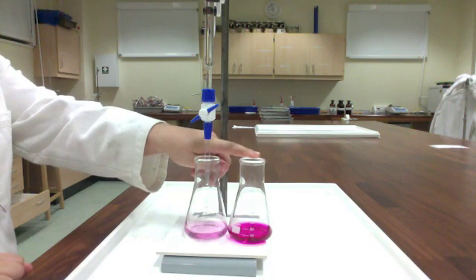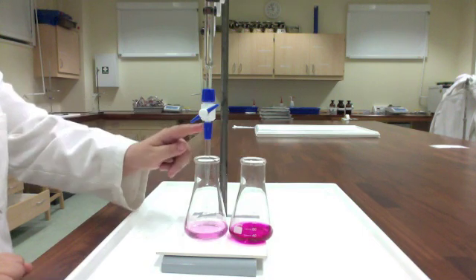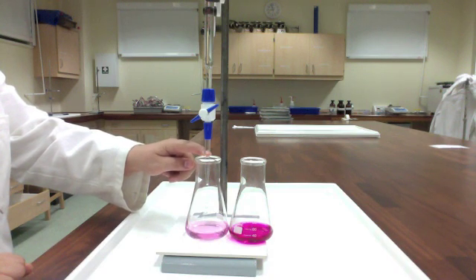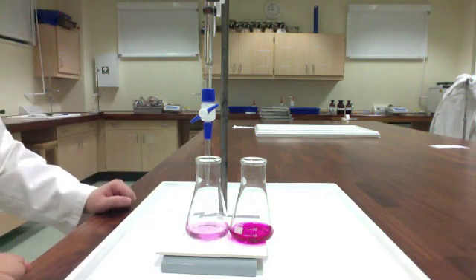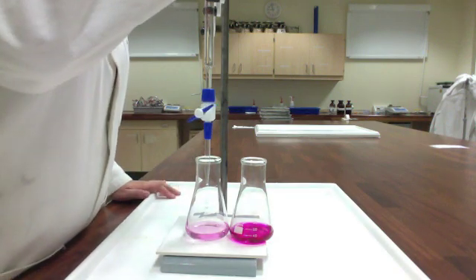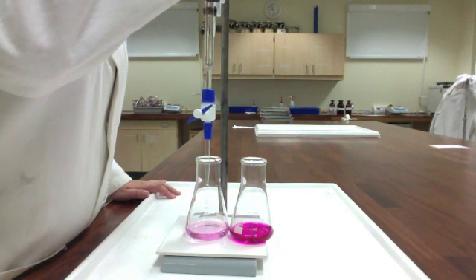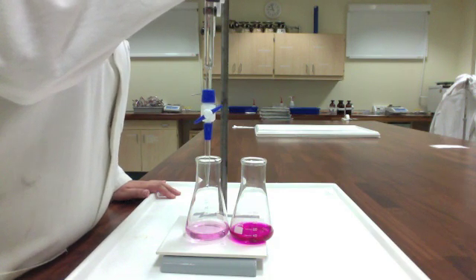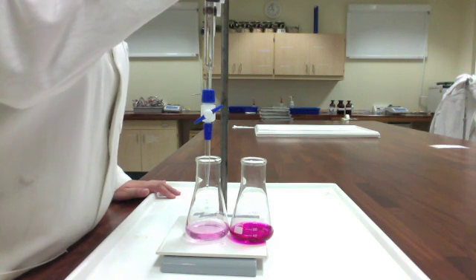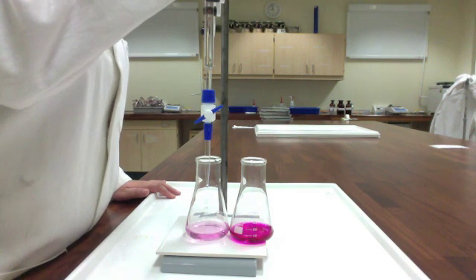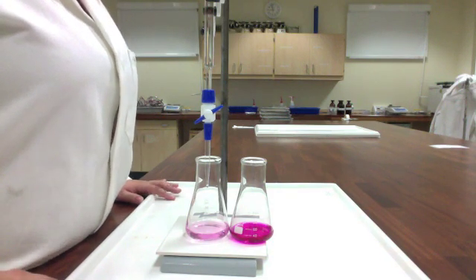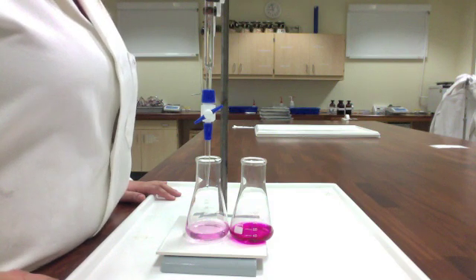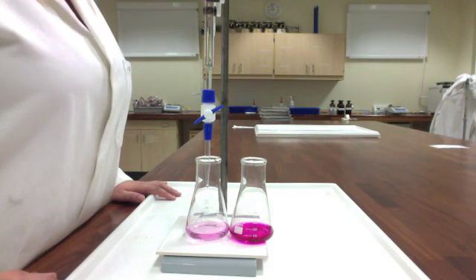Fast trial. Probably not going to fall within that acceptable range. Good trial. Very, very different shades of pink here. All right. Let me take this volume reading for you. 24.2. It's just over .2. So 24.22. I'm going to call that 24.22. Jot that down. That is our final volume of trial two and also our initial volume of trial three.